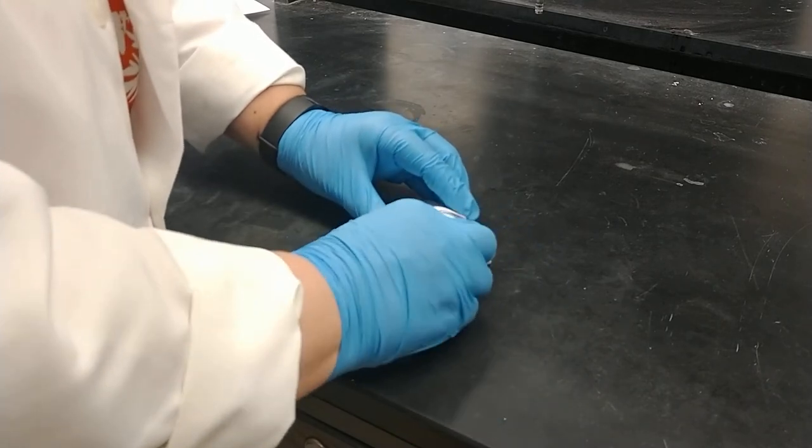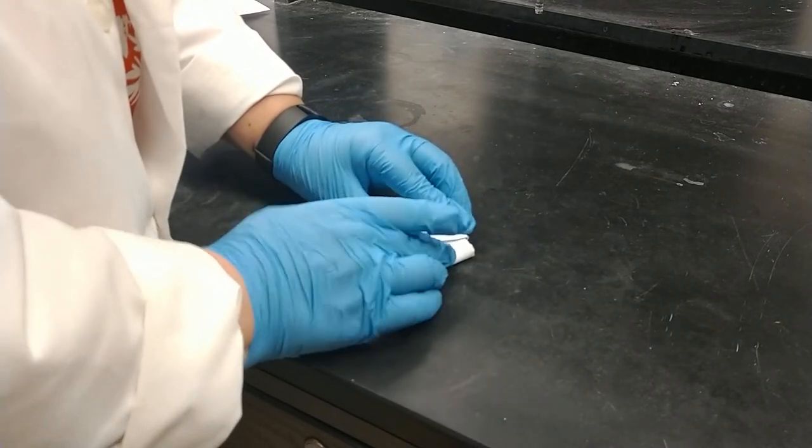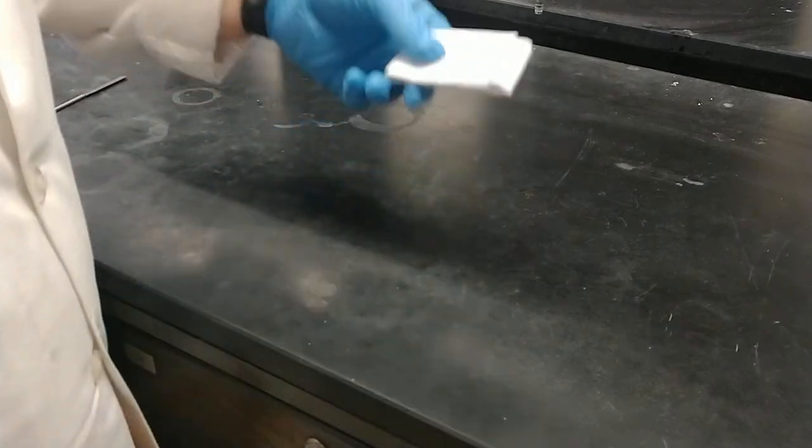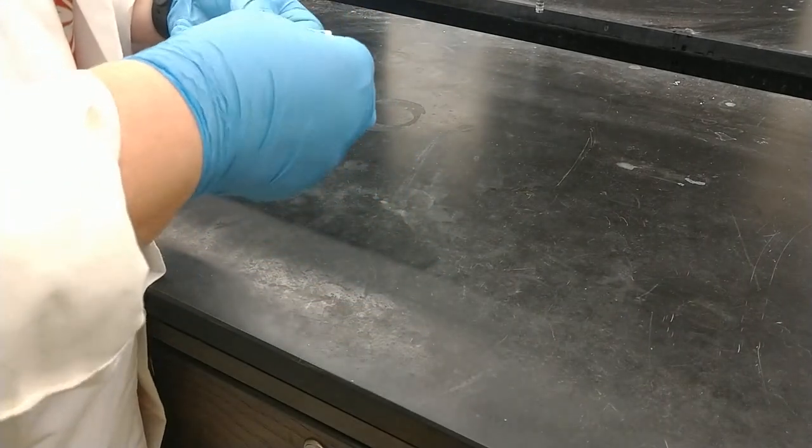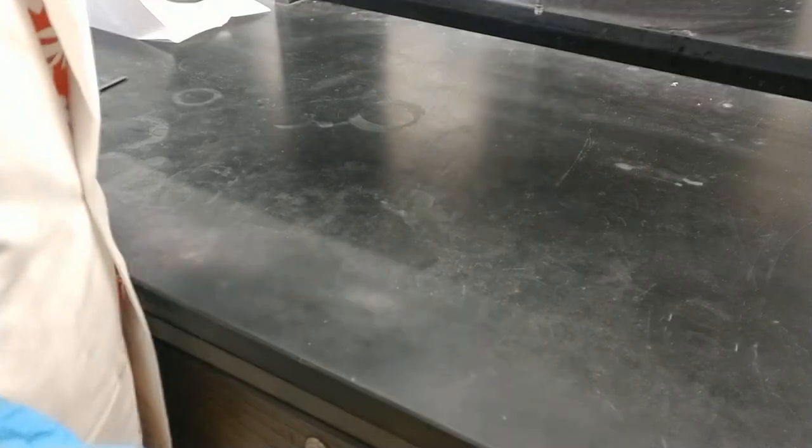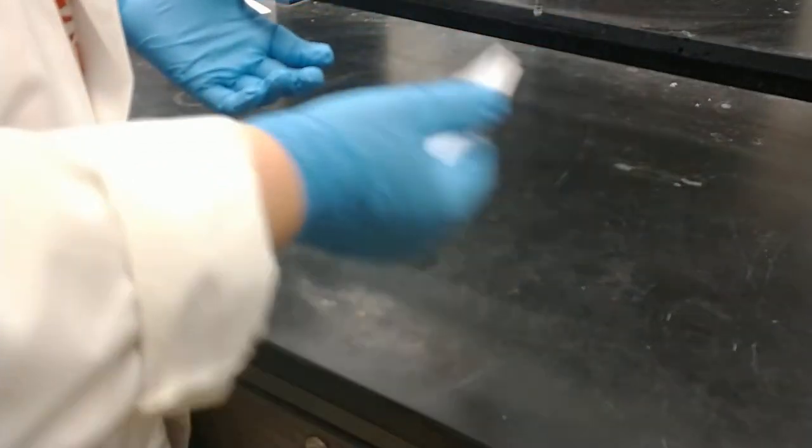Now you can imagine if I put this directly into a plastic bag without ever having put it in the druggist fold, this is not going to contain this nearly as well. So this can really go through an awful lot of turmoil.